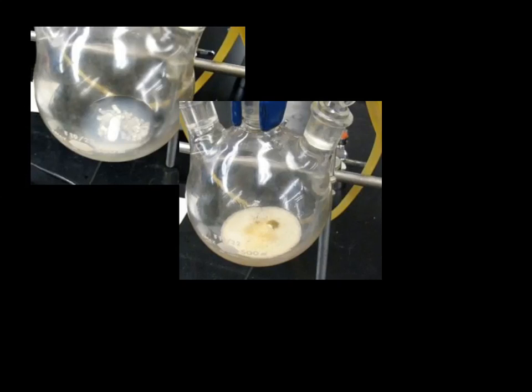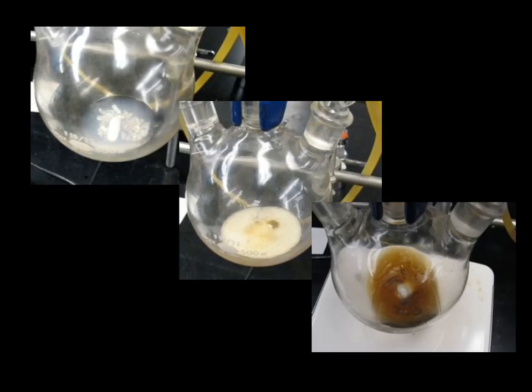A few minutes later, the temperature will rise to the point that the ether begins to boil, and the solution will turn brown and clear. You can then begin dripping in the remaining bromobenzene solution from the addition funnel. This should be done slowly over the course of about 10 minutes or so, at a rate that maintains a steady reflux. After the addition is complete, 5 more milliliters of anhydrous ether is added in one portion, and the reaction is stirred for 30 minutes. By that time, the solution should have cooled off, and it should appear brown and clear. There should be very little, if any, magnesium left.